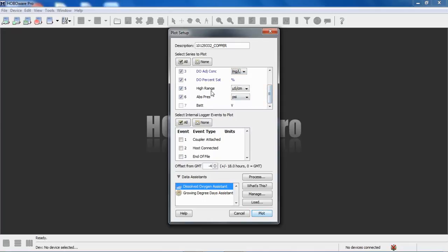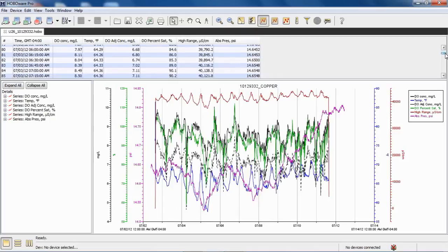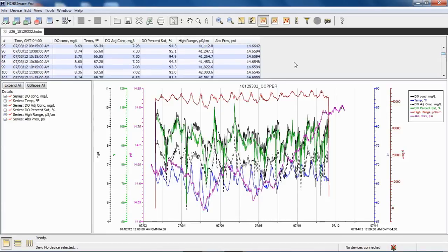Below that, here is the high range conductivity coming from the U24 data file that we decided to use, and the absolute pressure, which is the barometric pressure we're using from our U20 file. And we can uncheck these if we're not interested in seeing them plotted, but we'll plot them just to have a look. So here is our data. You notice these series, there's nothing in them because our barometric pressure logger started logging before the DO logger, so we can scroll down through the data, and here we go. There's where all our data is.